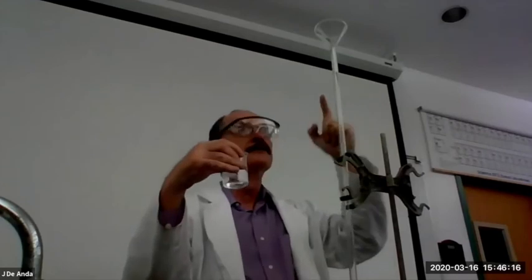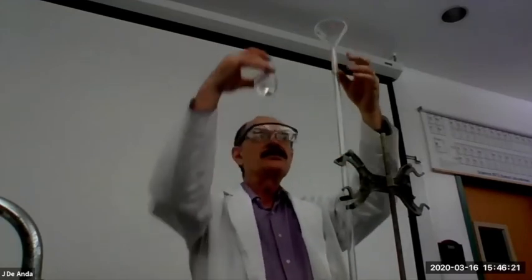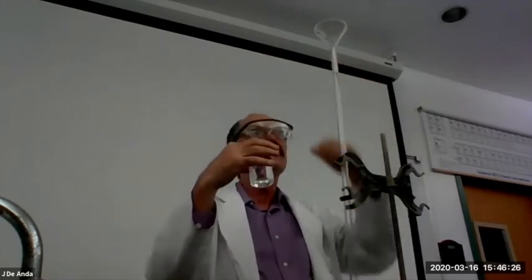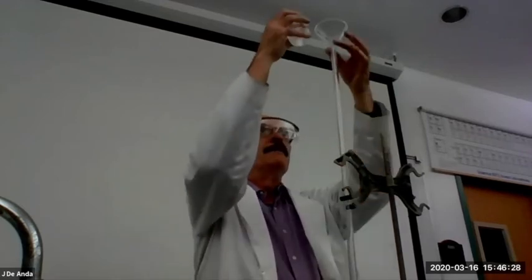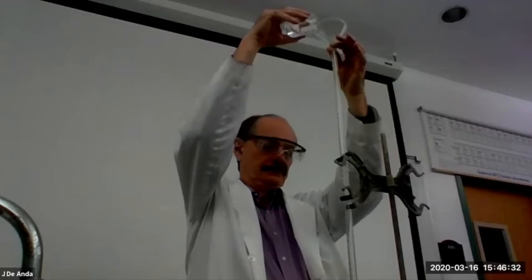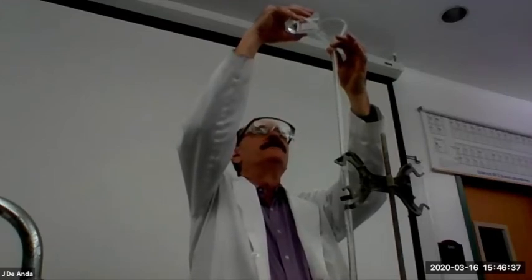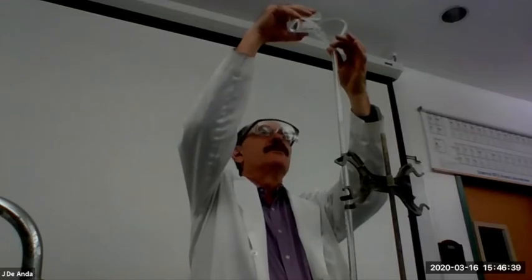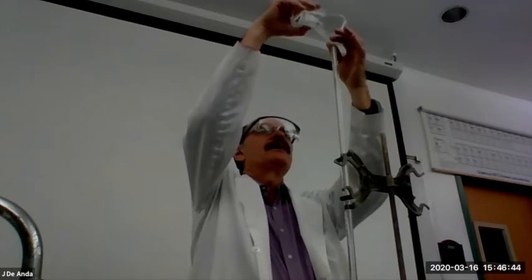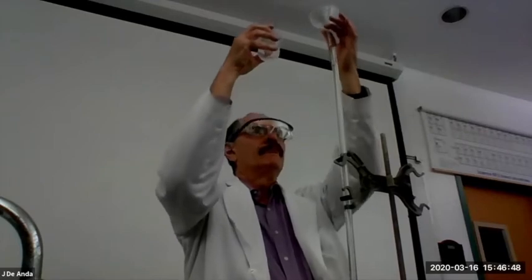Now, be careful. Sometimes the glass funnel makes a seal here. And then when you start pouring the liquid, the air pressure inside builds up and doesn't let any more flow. And then you're going to have a spill. So maybe hold it a little bit higher and then pour it down. And it'll take a little over 50 milliliters of your KOH to fill the burette. You want to bring it a little higher than the 0 mark. All right. And then pull it out.